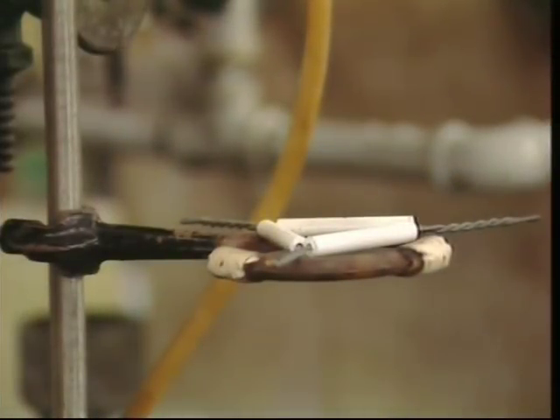Another safe procedure to learn is how you should handle containers of chemicals. When you lift something from a shelf, make sure you have a firm grasp on it so that it won't slip out of your hands. And never assume that the cap, stopper, or closure is secure before lifting it.